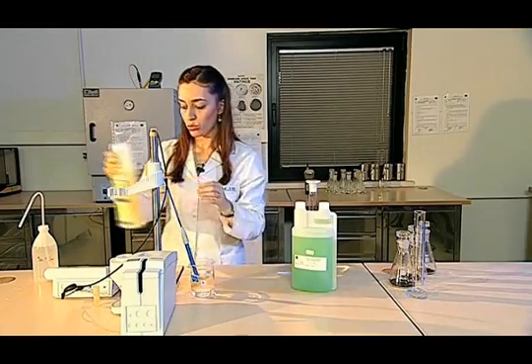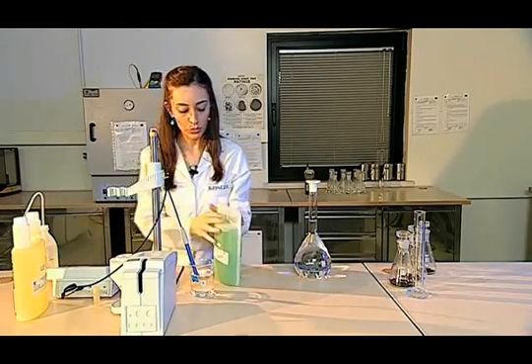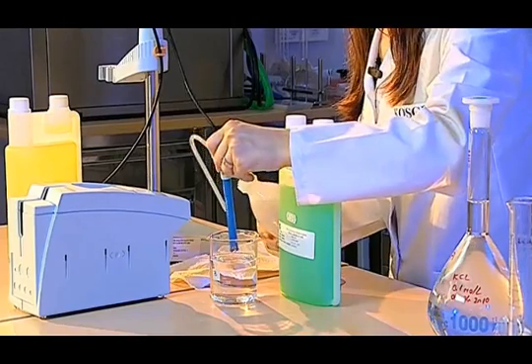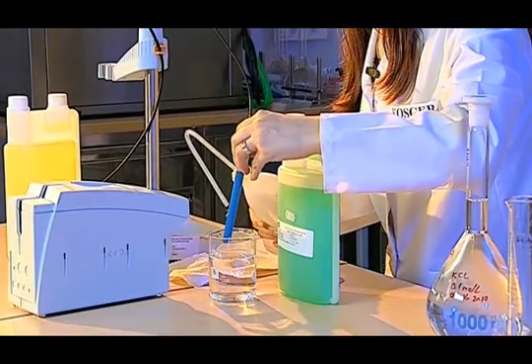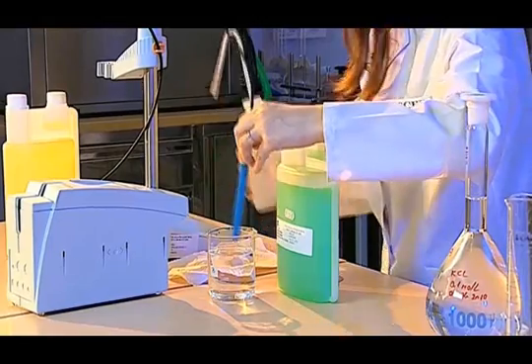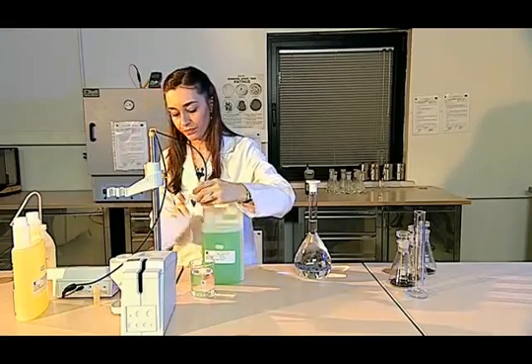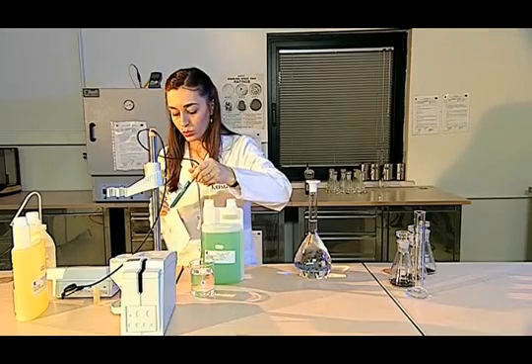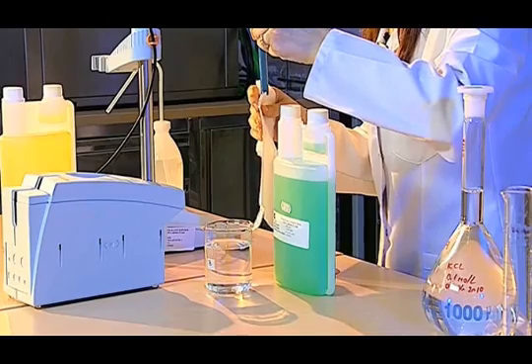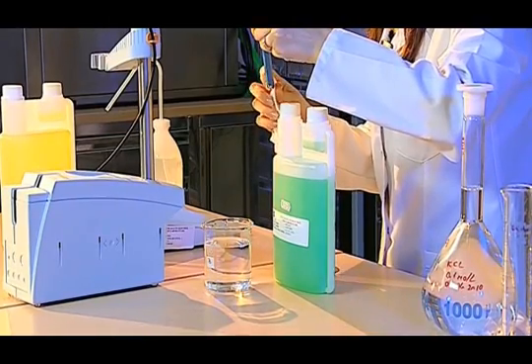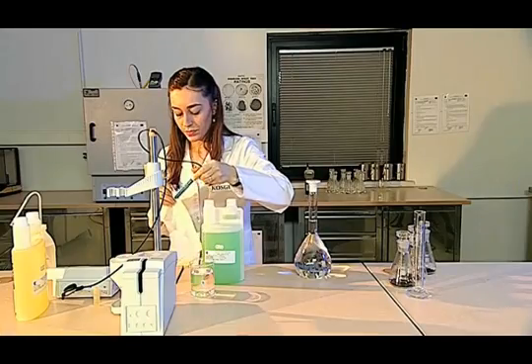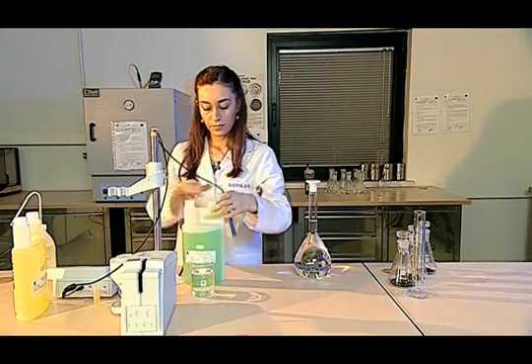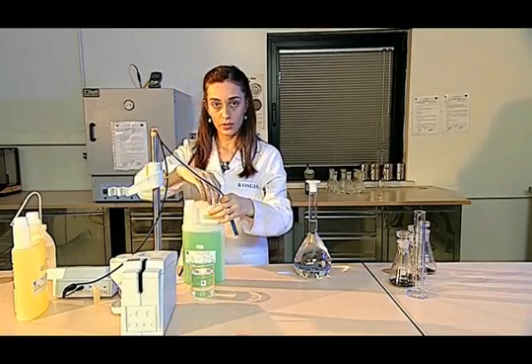In the final stage of the pH 7 calibration, I go back and measure the pH of it, and the calibration of the pH is completed. The tip of the pH meter, namely the tip of the electrode, is a very sensitive piece of apparatus and should never be exposed to shocks and its tip should be cleaned properly every time.